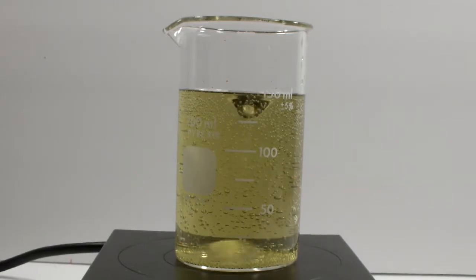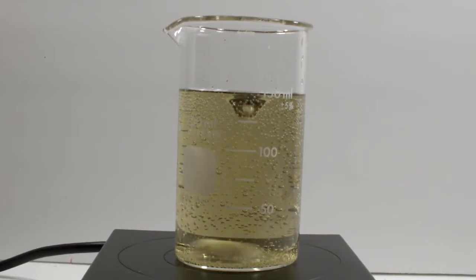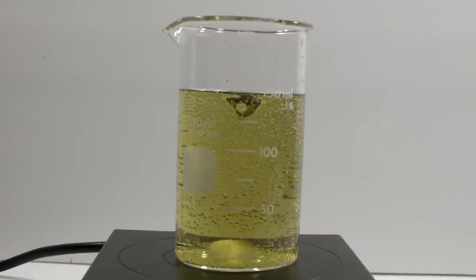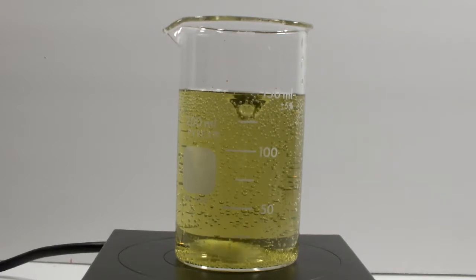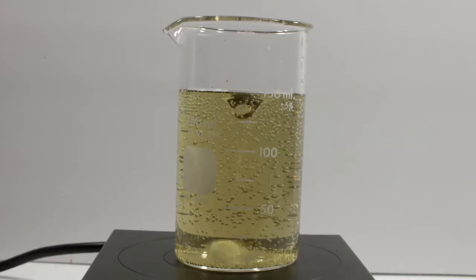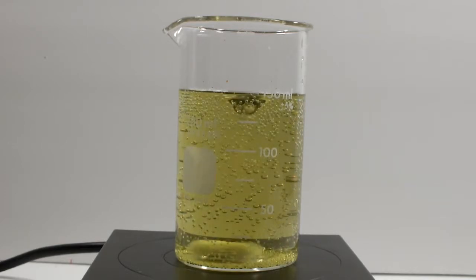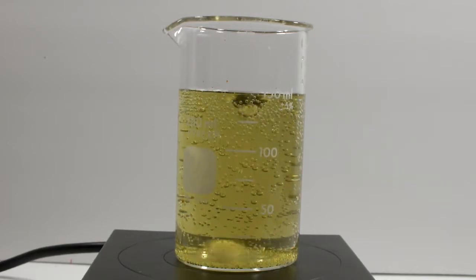This is a couple of minutes into the reaction, and as you can see, a whole bunch of bubbles appeared. As we learned in the last video, this is an indication that the old malonic acid solution is in fact no good. I can confidently get that off my shelves, but I'd have to mix up more of that solution and some of the potassium bromate to see if I can get rid of the potassium bromate too. The problem is there's another variant I want to try, and my supply of malonic acid is running very low. So let's move on, and if I have enough malonic acid left over, I might try this one more time.